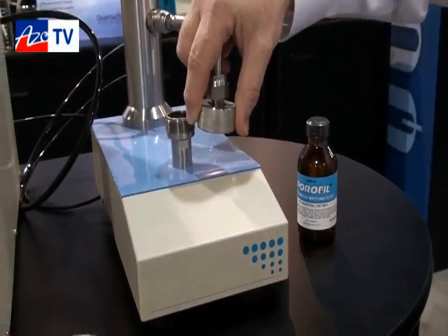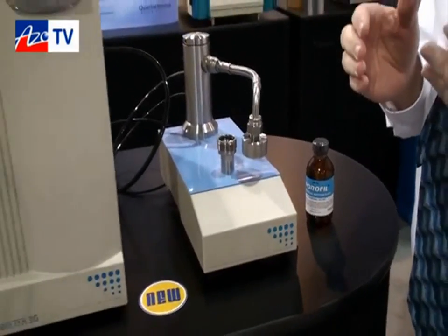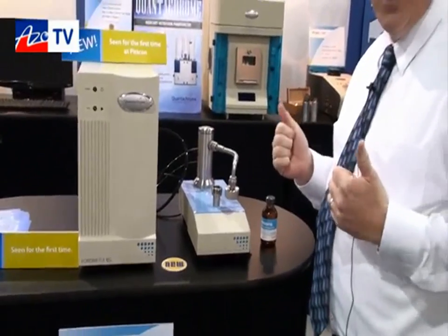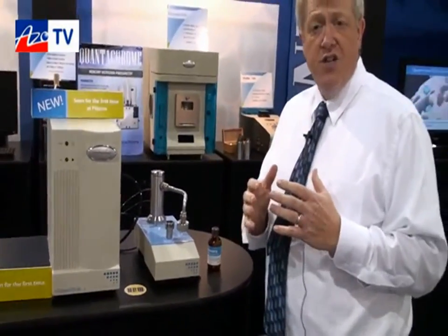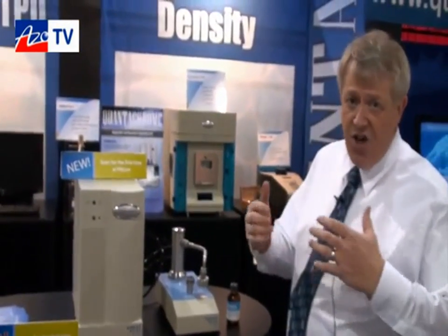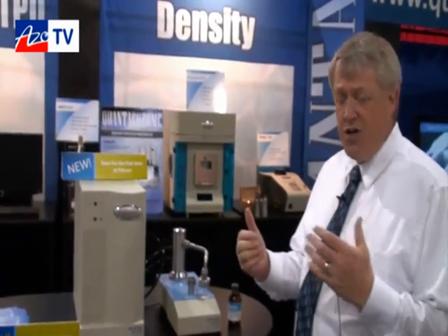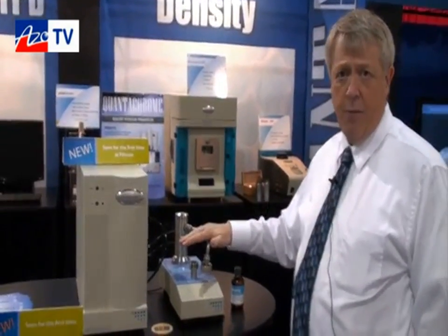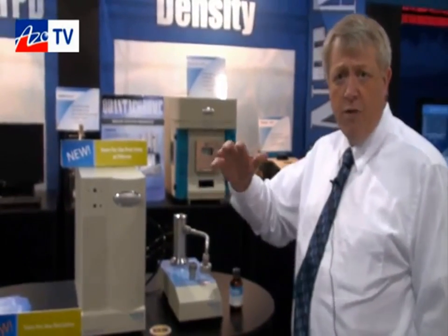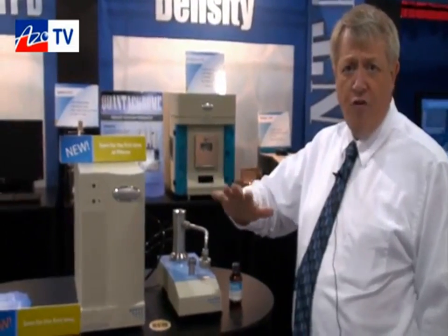the software, the only parameter that the operator has to set is the starting pressure and the total finishing pressure. The starting pressure, the lowest pressure, determines the largest pore that's going to be determined. The highest pressure, the ending pressure, determines the smallest pore that's going to be determined. And what the instrument actually does is, once the operator just clicks start, then gas pressure is applied to the top side of the sample, and at some pressure, that applied pressure will be able to push the wetting liquid out of a pore.